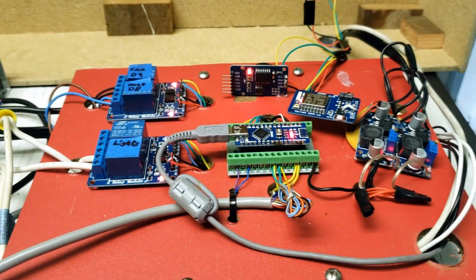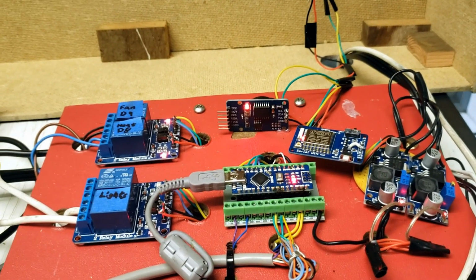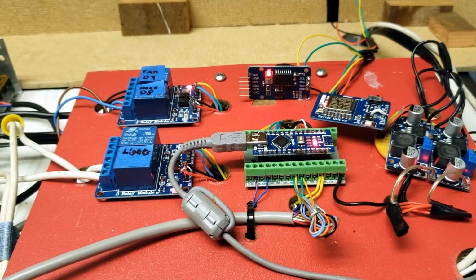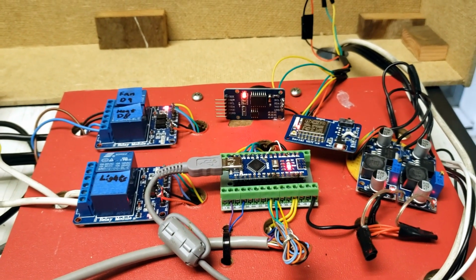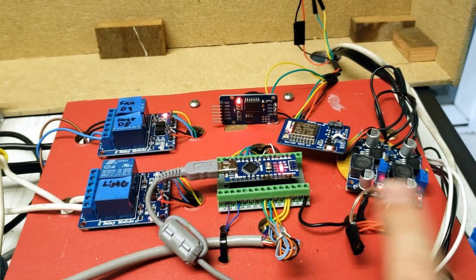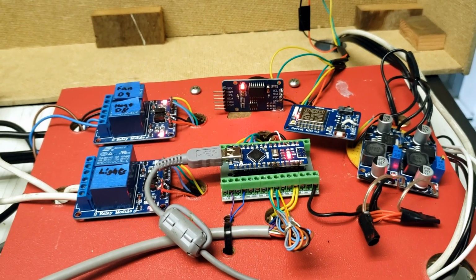It's really fairly simple. The Wi-Fi does get updated every 20 seconds. So I think that's the maximum that ThingSpeak allows. I don't need much finer data than that anyway. So every 20 seconds that will upload to the cloud and I will be able to check it on my phone. And that is it for the electronics.